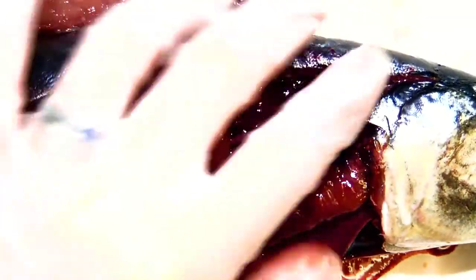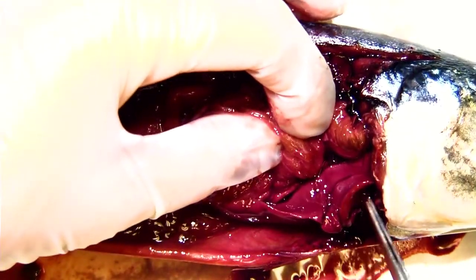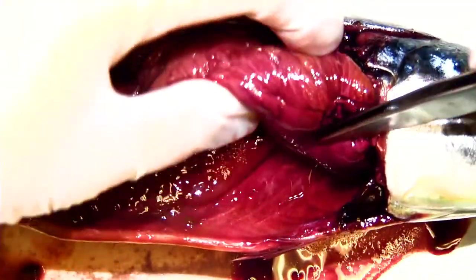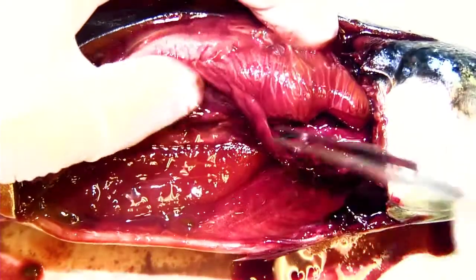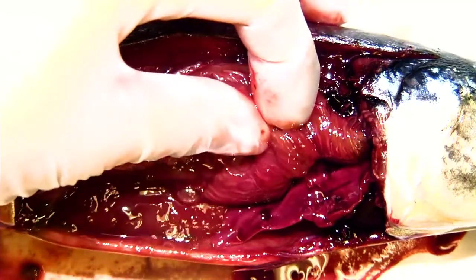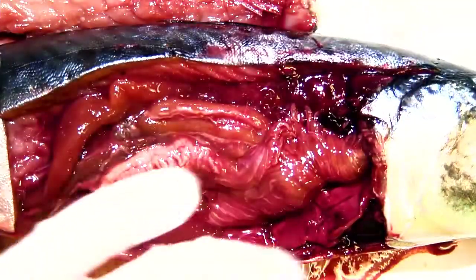One more thing for their digestive system — they do have a liver. Right here is the fish's liver. You can see it is lobed very similarly to our liver. And that is basically the inside of a mackerel.